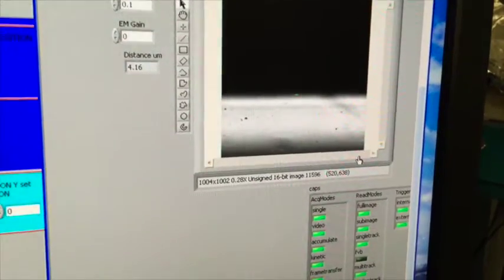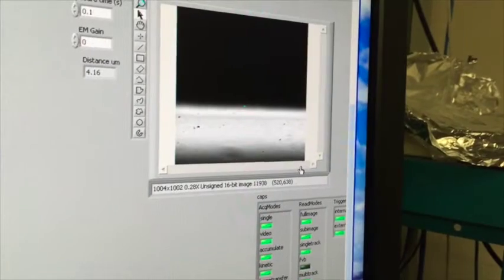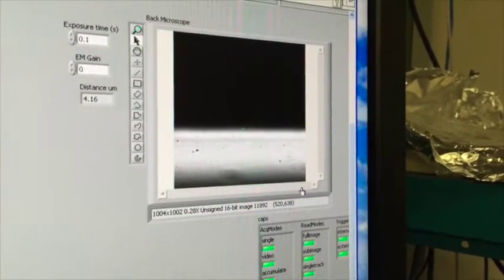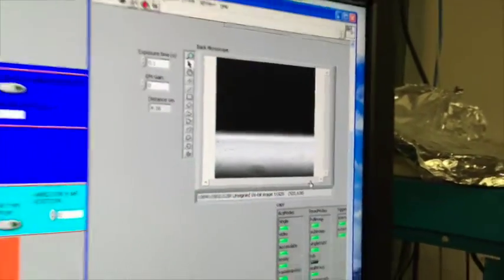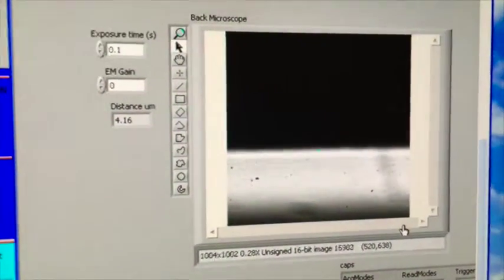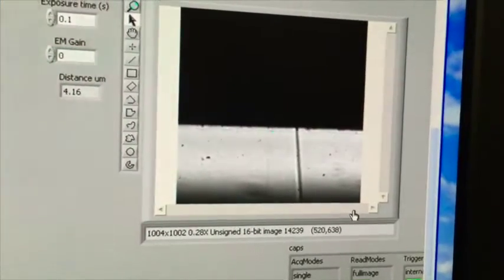And sometimes I have to do it a couple times to make sure that tip breaks. But that bottom dark shadow is all the way back. I know my tip has been, the scissor is kind of open again. Now I'm going to move the crank clockwise. So I'm moving it clockwise now. Clockwise. As I move it clockwise, it pulls back that blade, and we can see that that tip is broken.